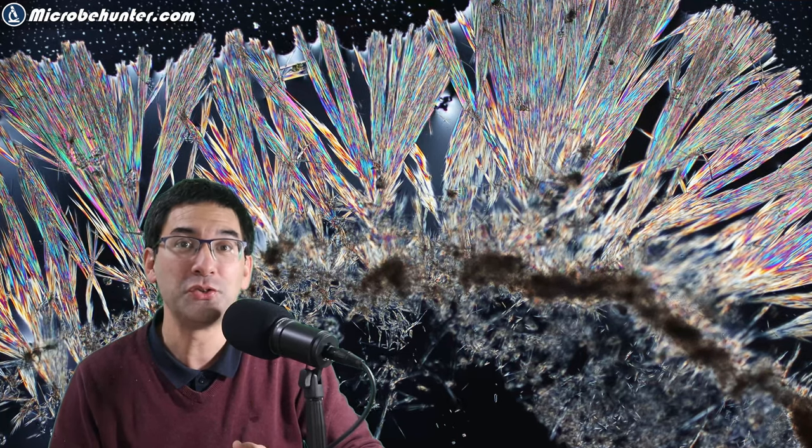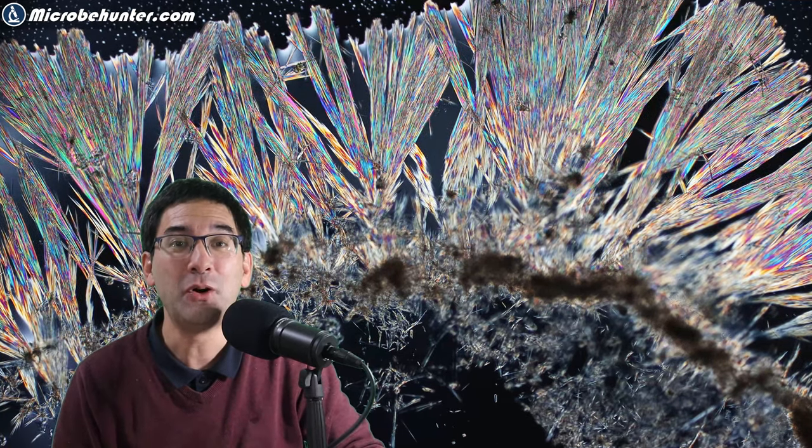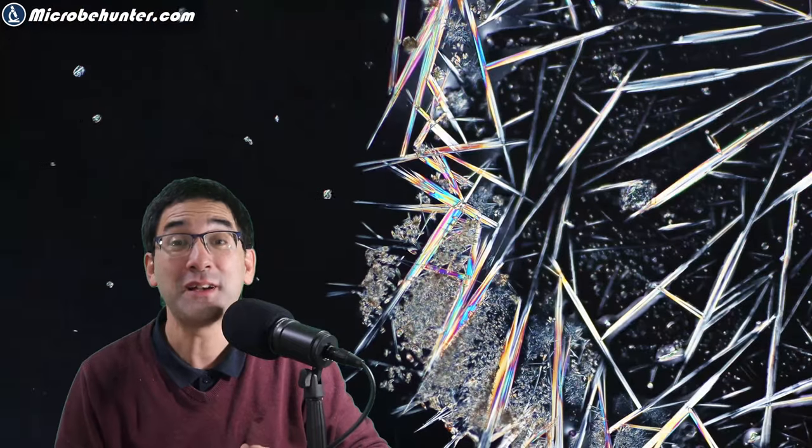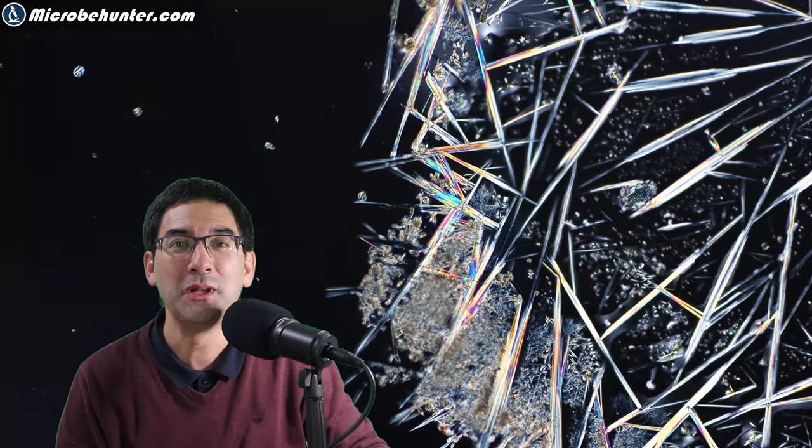Today in this video I would like to show you how you can do this yourself, how you can crystallize caffeine on a microscope slide for observation, but you have to wait until the end of the video where I show you how. As a matter of fact, it is quite easy to do if you know how.